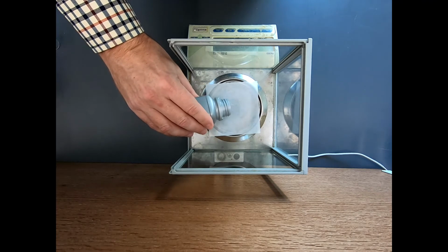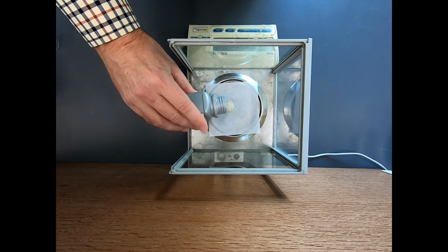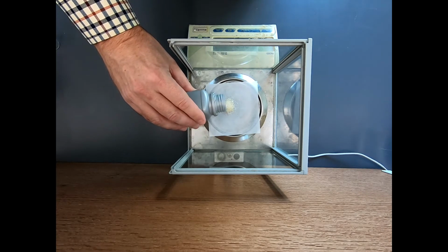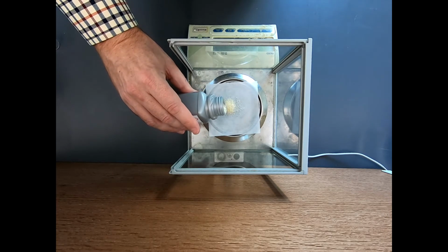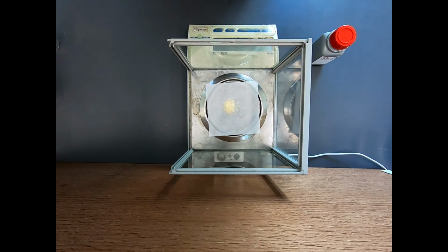So let's go ahead and tap this out. We're way low. It's about 200, 300, 400, 500, 600. Slow it down. And again, I don't care exactly what I get. Okay, that's overshot a little bit, but that's okay, because I do want to measure this out fairly precisely, and I want to get my stoichiometry as close as possible to 1-to-1.